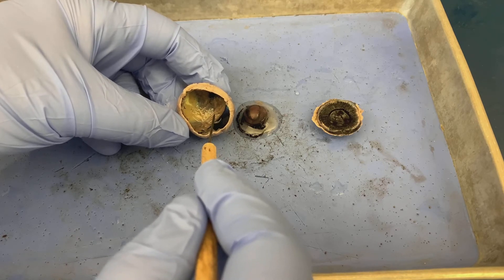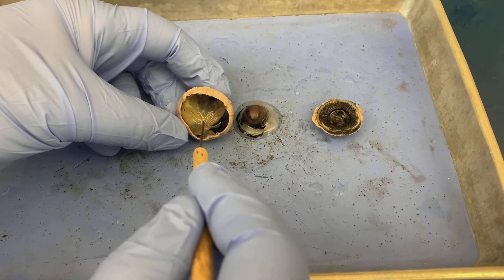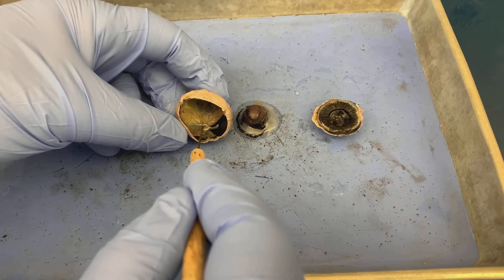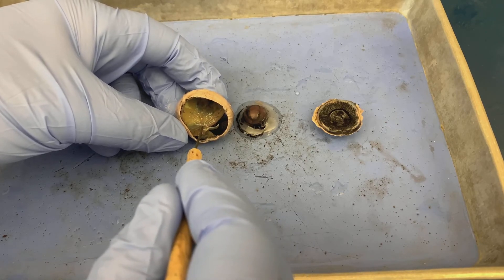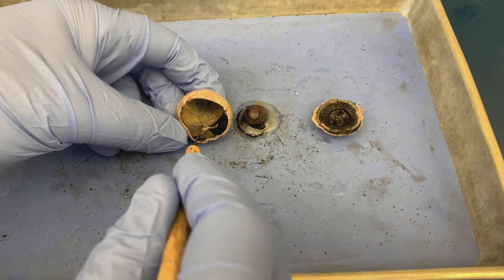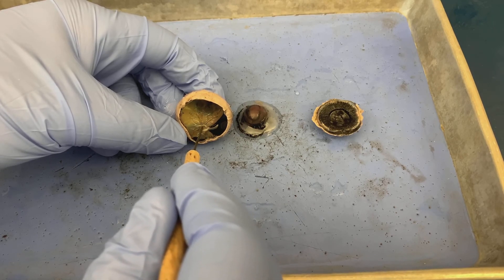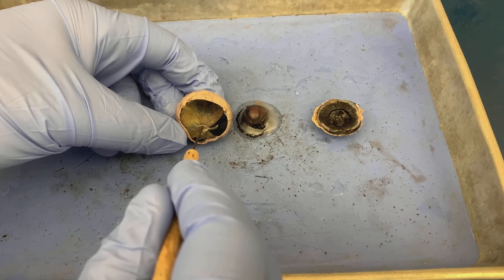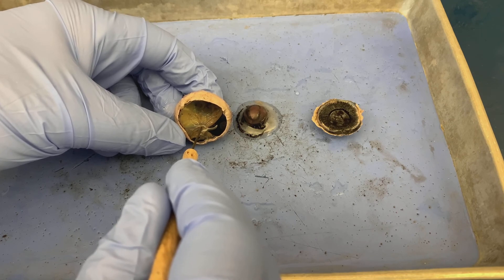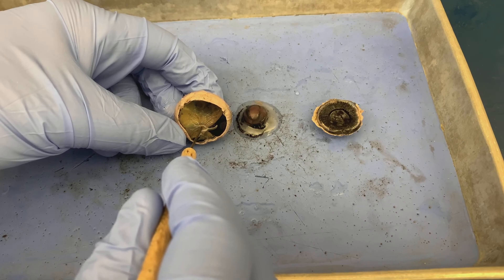If we look, we see where these pleated folds on the retina all form a kind of star formation and go to one centralized region. You can see all these little wrinkles or pleats going right to this centralized location. That is known as the optic disc, or the blind spot. This is the area where we have no actual photoreceptors and that cannot form an image on the actual retina.